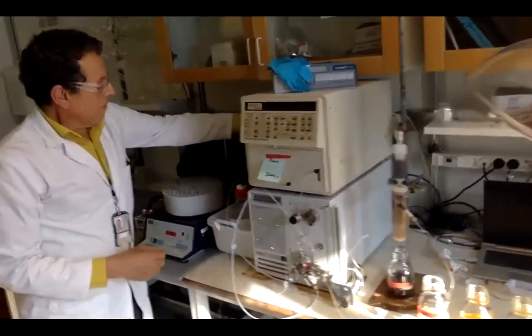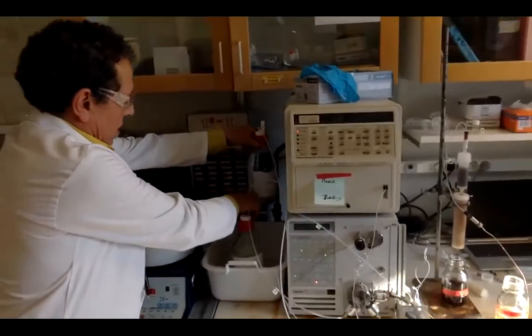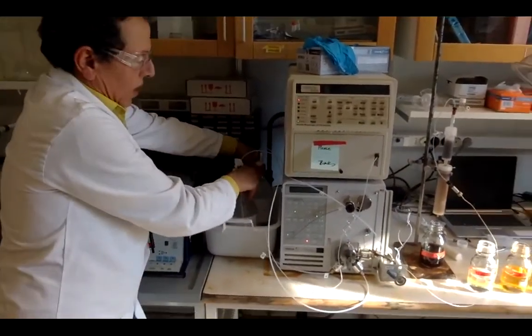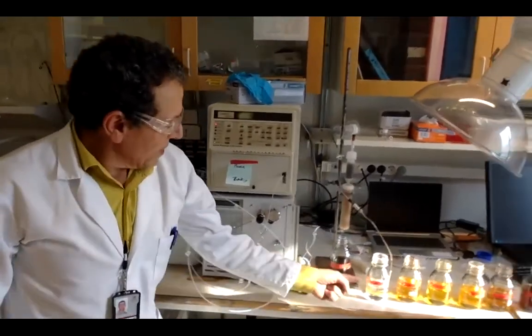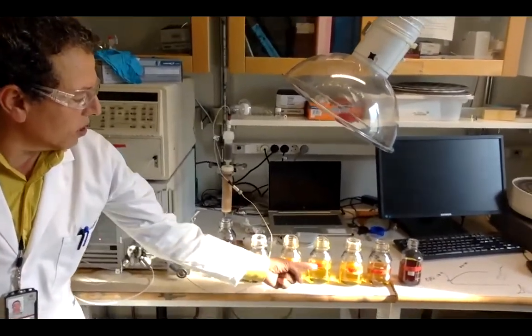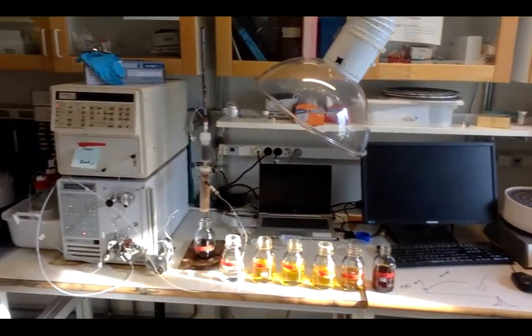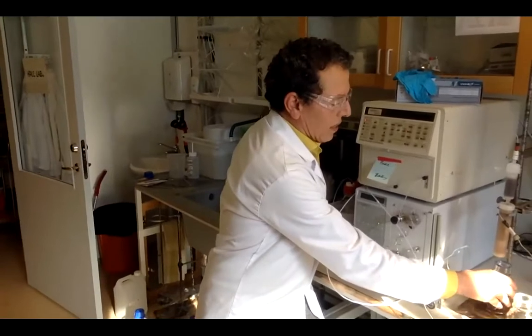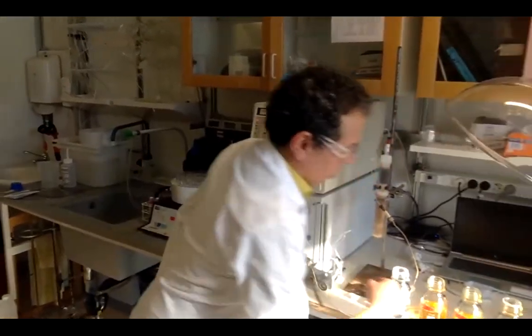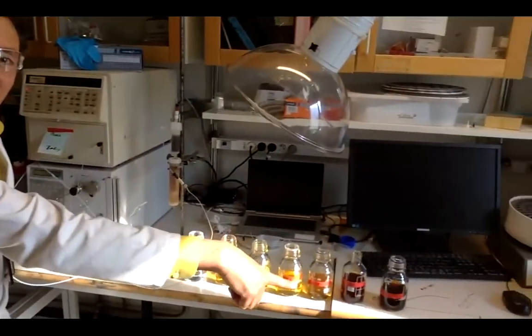In this case, we have hexane, ethyl acetate, and methanol according to increasing polarity. As you can see, this is according to increasing polarity. It is a very effective method of isolation. According to the color, it looks good.